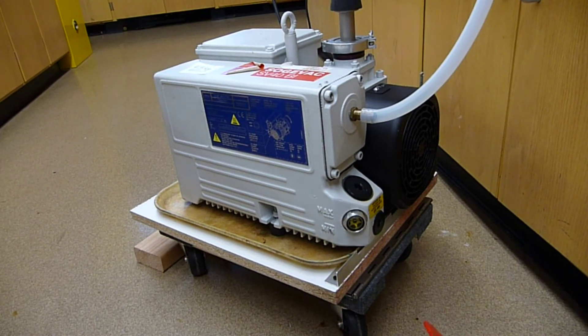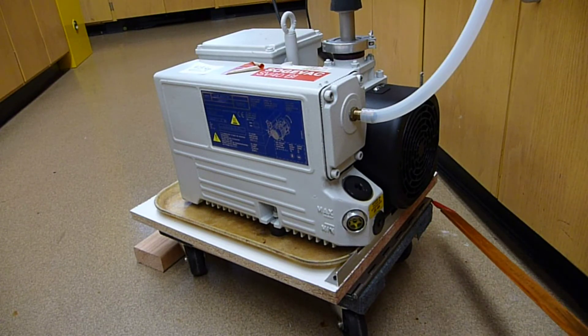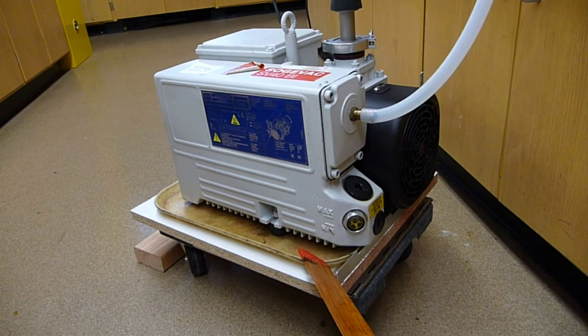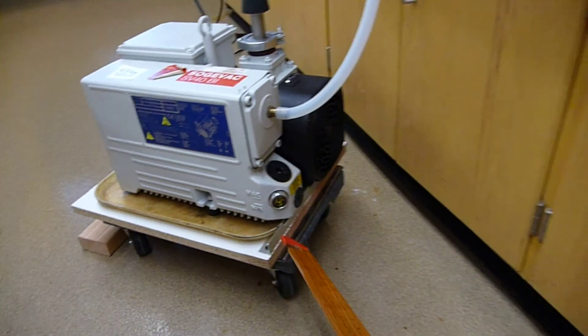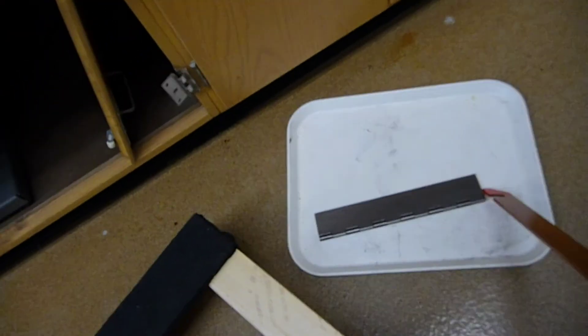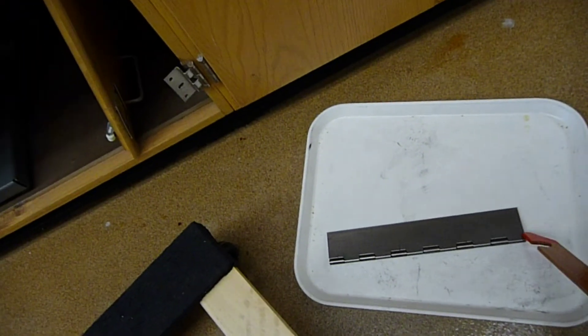The basic components are a small furniture dolly down here, a hinge here, a piece of wood, a one-by-one angle aluminum, and a tray. Some of the unmodified pieces are over here: your typical furniture dolly, a tray, and then a heavy-duty hinge.